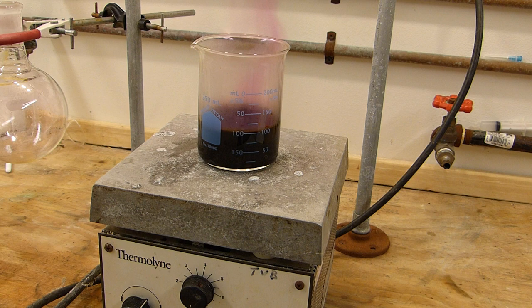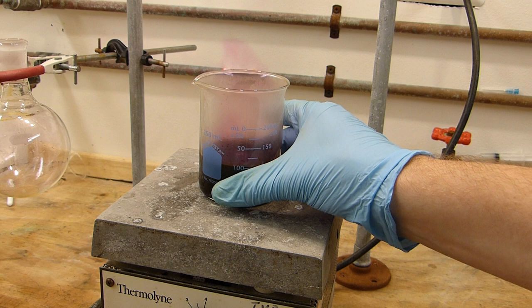You can see immediately we've formed iodine and our iodine is giving off the purple vapor because it is quite warm. Well not quite warm but just a little bit warm.